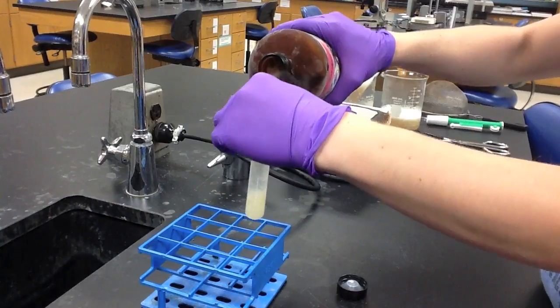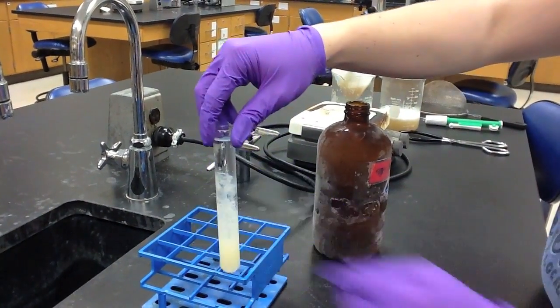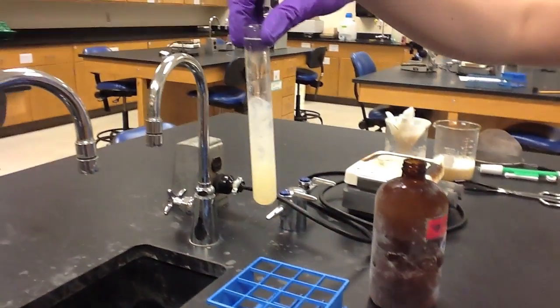Because DNA is insoluble in ethanol, we are finally able to visualize the DNA in the test tube when we add the ethanol.